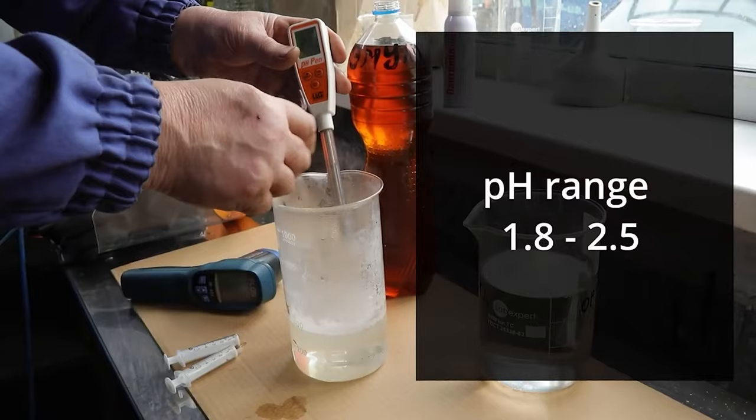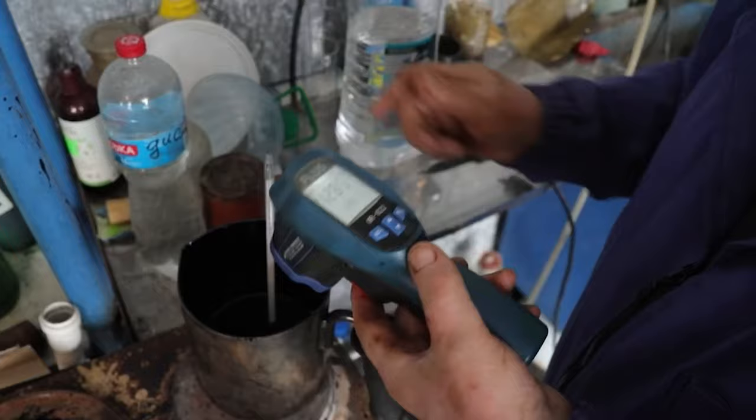Having prepared the blend, we heat the bitumen stirring it gently and bringing it gradually to the temperature of 140 degrees Celsius.